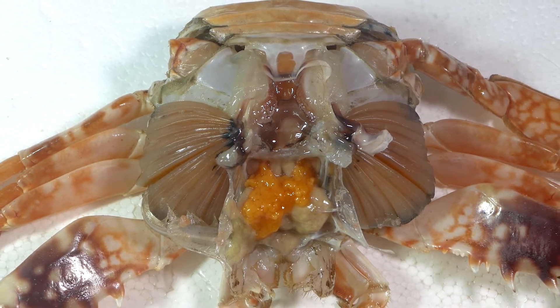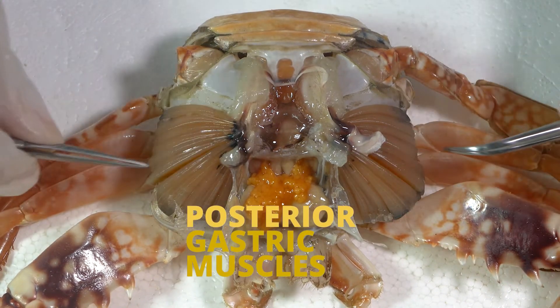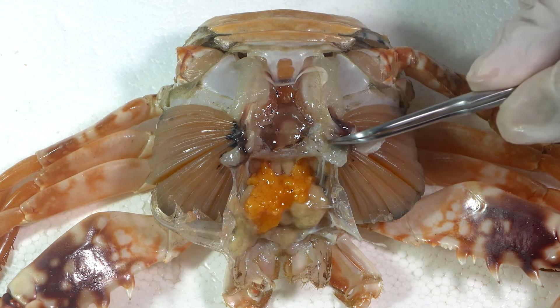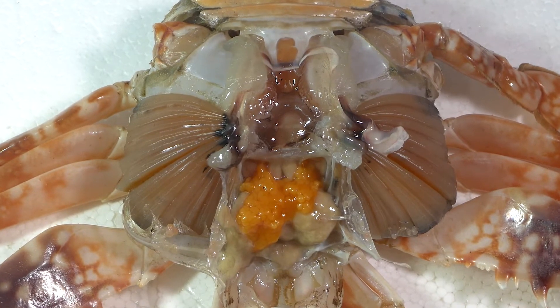This thin layer of tissue is removed together with the cephalothorax when you dissect it. The gill chamber is actually isolated from the hemocoel chamber inside. Notice the gills come to a point so that the heart can beat, pulse, and push the blood received from the gills out to the body.